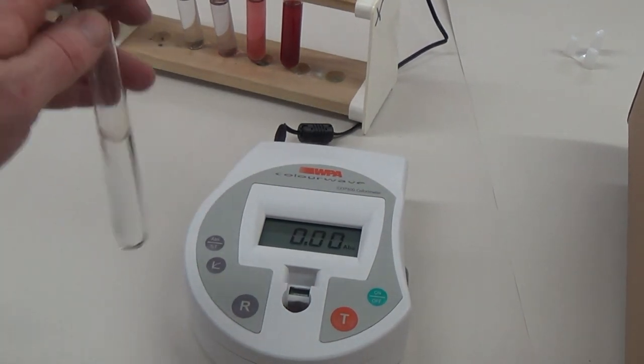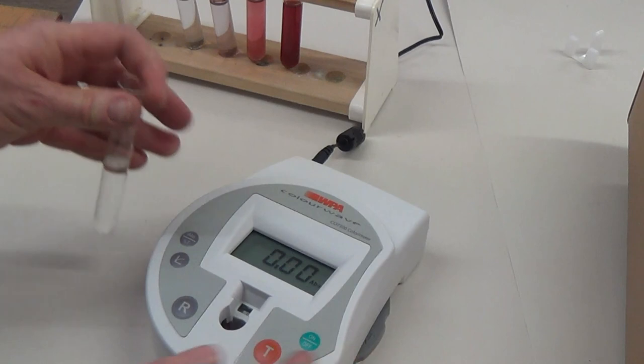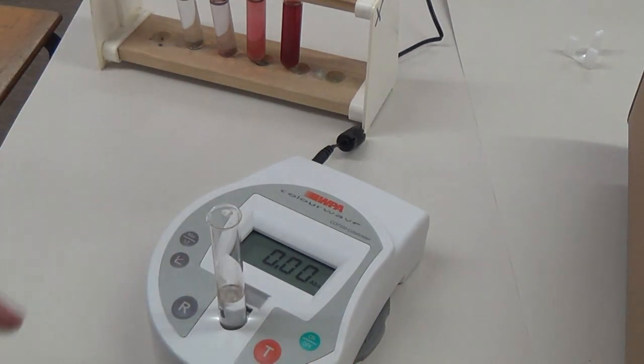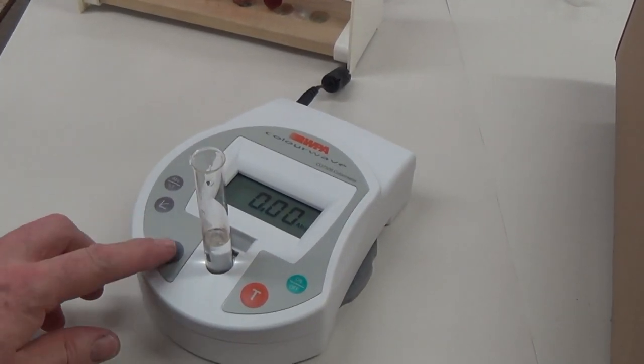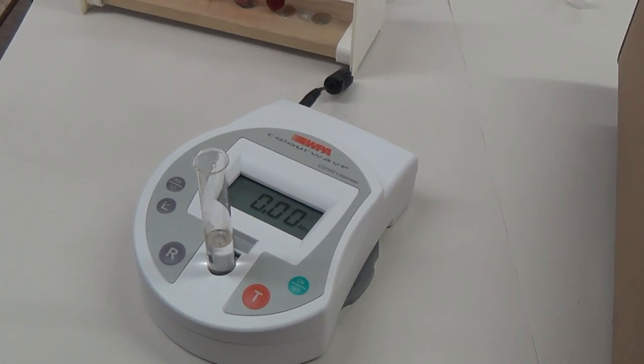Let's have another look. So my reference, place that in, press R, and it should be zero.